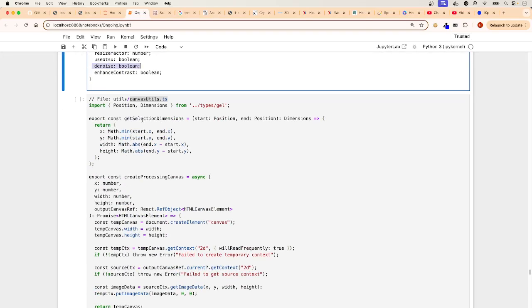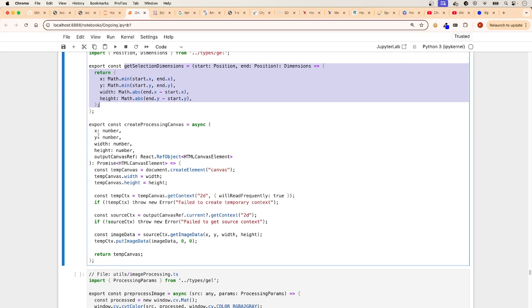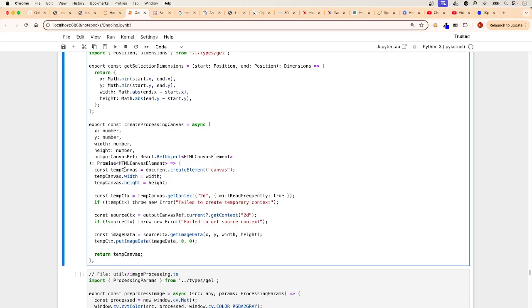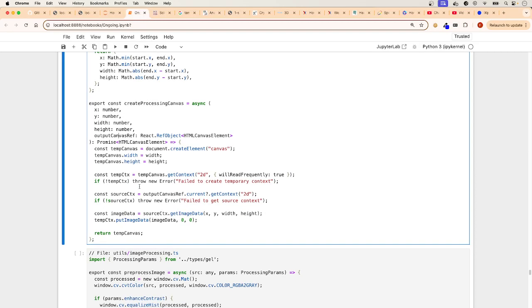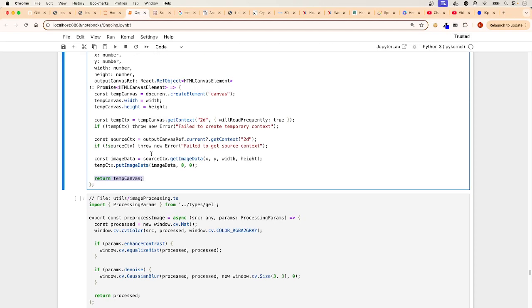Then it's going to go into the Canvas utils helper file. It's a very important file because this file is the one that allows you to create the selections, the dimensions of your rectangle as you click, as you make the rectangle. We saw that in the other tutorial. We're just creating the temporary canvas. It creates a temporary invisible canvas, and it just copies the parts that we want to concentrate on instead of the whole image. It lets you process that particular section instead of the whole image. Then it returns the temporary canvas for further processing. That's what that's doing.